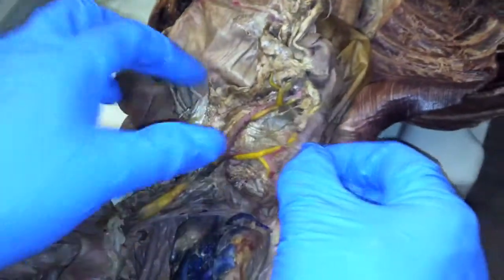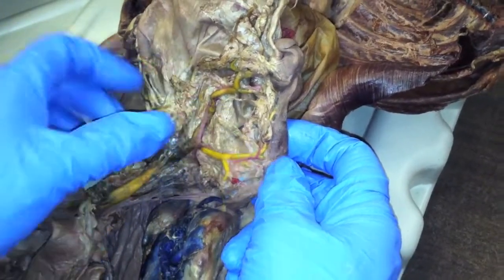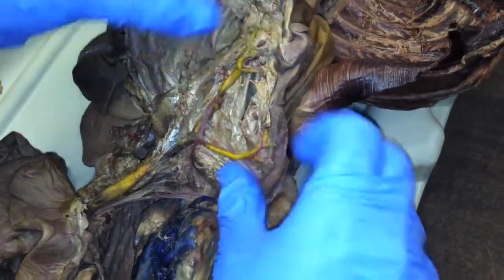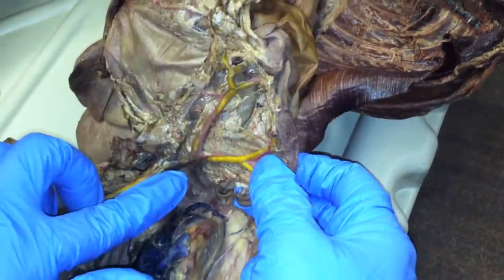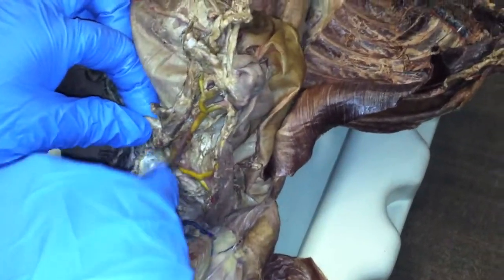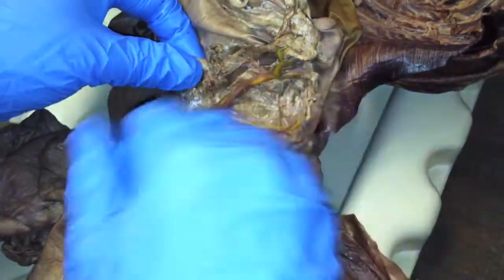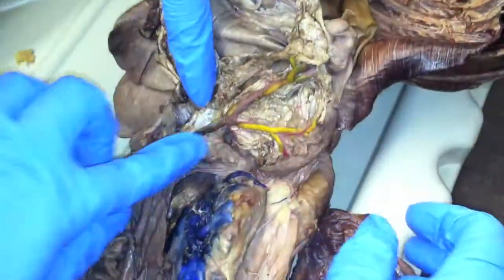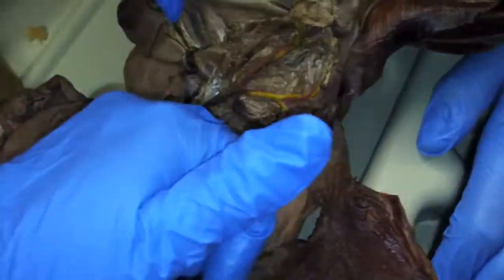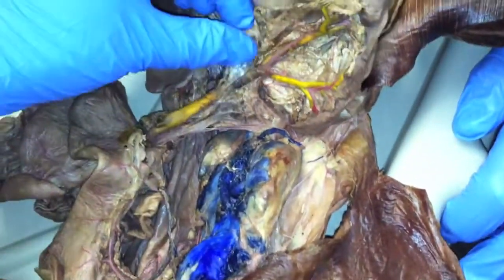This looks like splenic. Well, you can see the arteries in there, the pink ones, come in right there. So this looks like there's one branch and there's your other one coming. So this would be anterior, posterior. Then they come together and then along with gastrics coming from above become your gastrosplenic. So splenic and then gastric, then gastrosplenic. No, not that one — that's your cranial mesenteric. It's the one coming across here. But you can see other things coming into it there.